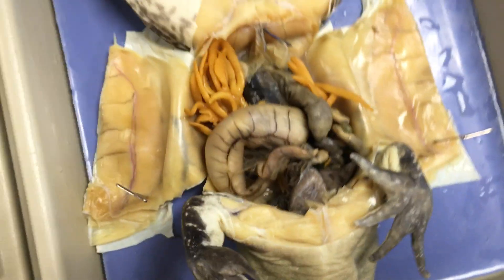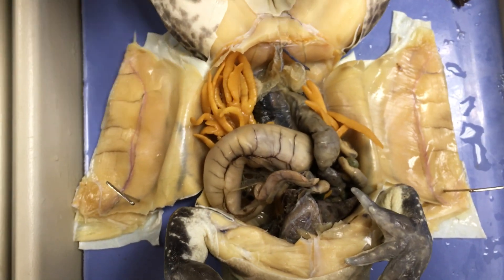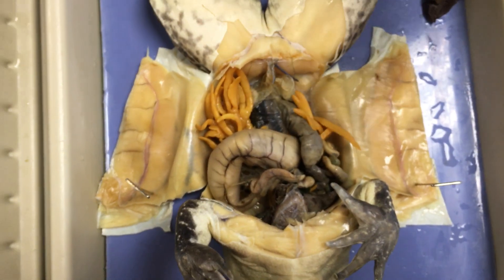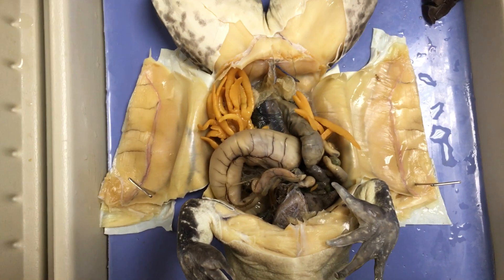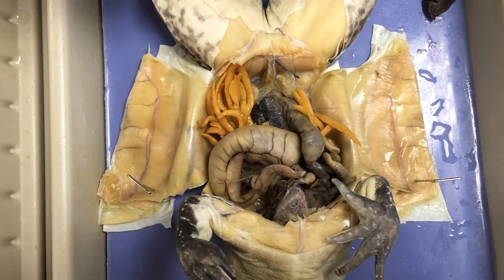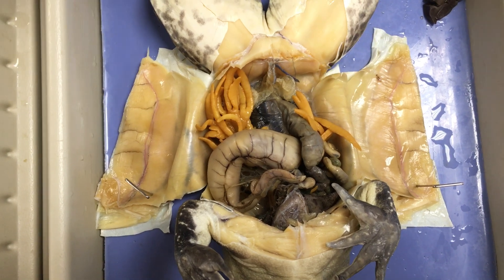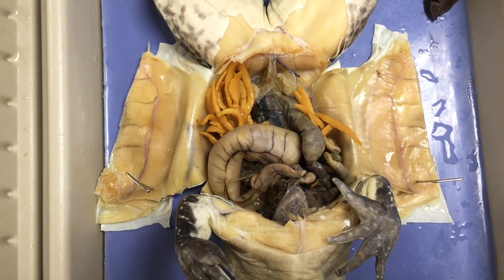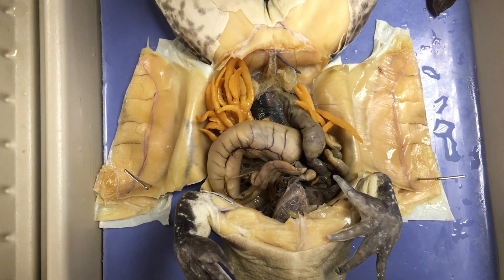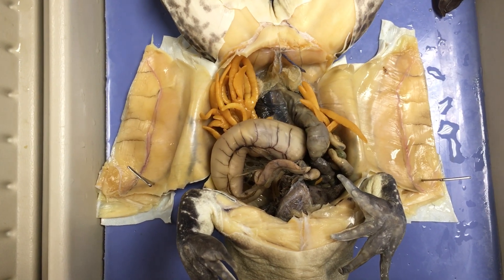Frogs do the majority of breathing through their skin, so they have very underdeveloped lungs. Amphibians need to stay moist, and one of the reasons is because they can absorb oxygen through their skin. So they don't use their lungs nearly as much as an organism like us.